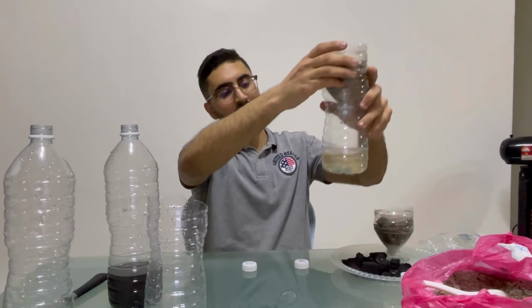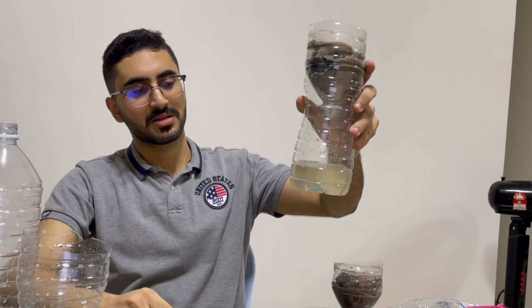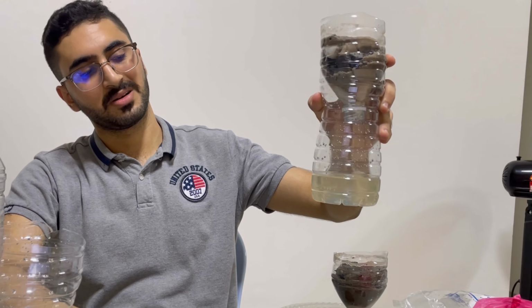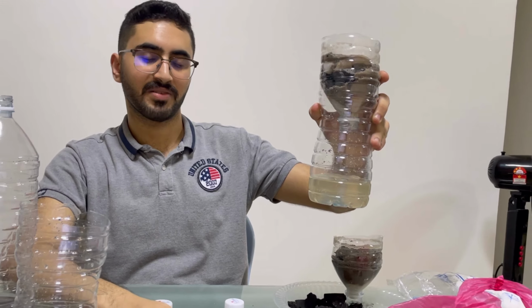So far, this is our result. The color is somehow white and everything is good.